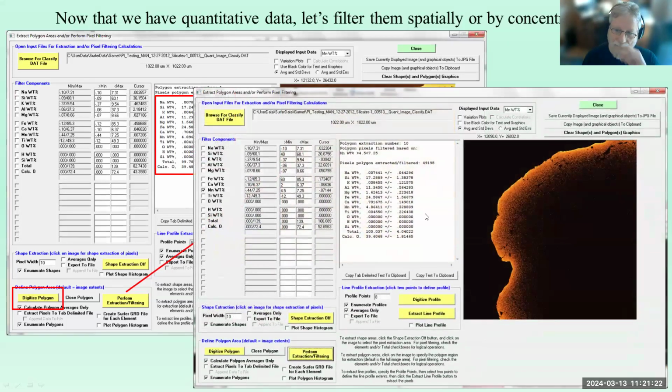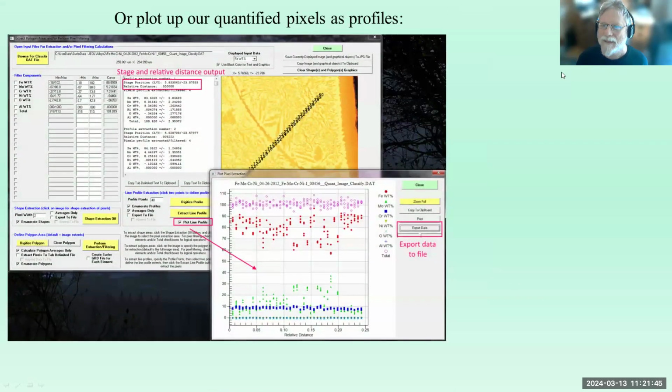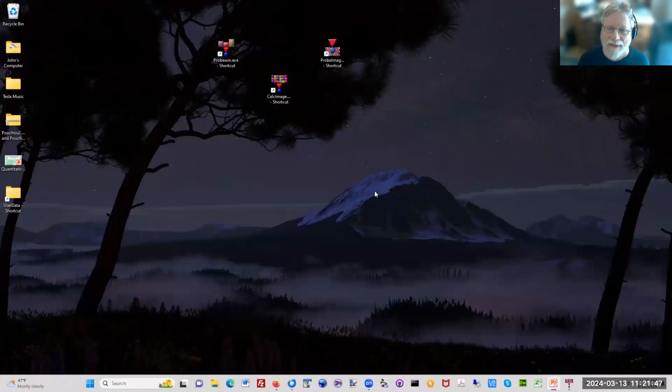And here's a way where we can actually say, only show me manganese concentrations between 4.5 and 7.25 weight percent. I don't know what this would be useful for, but you can do these kinds of calculations. There we go. So let me show you that in CalcImage.